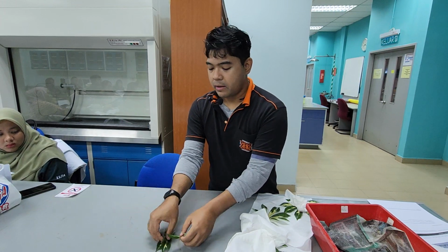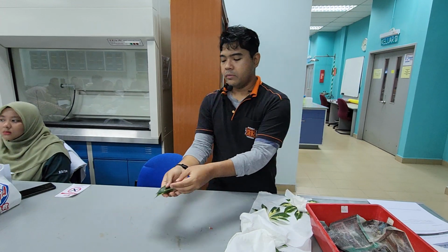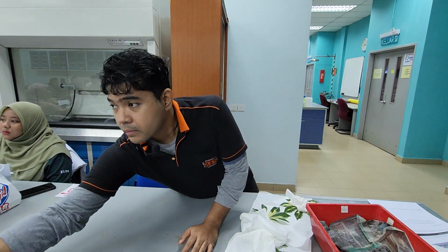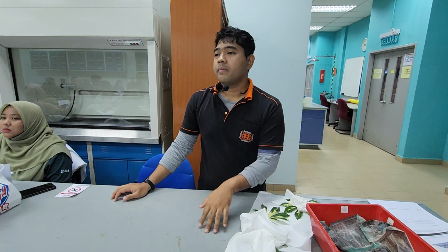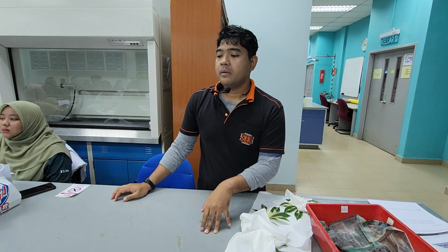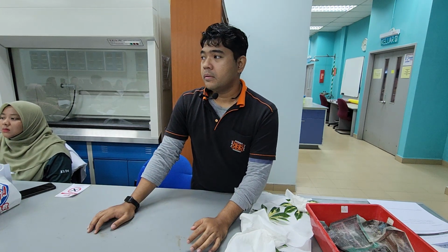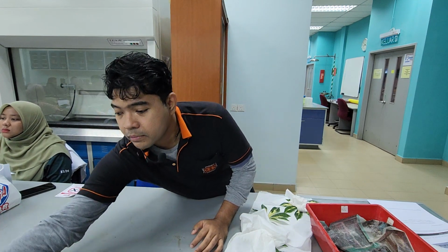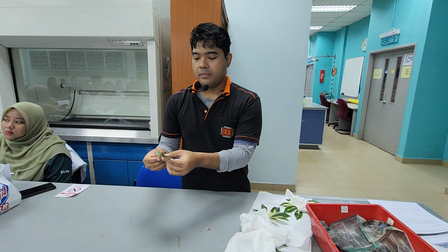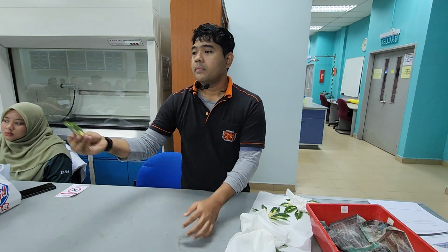Can you turn on? Somebody turn on that thing. Run it through. Is it running? Can you run this? Run this. Salah.